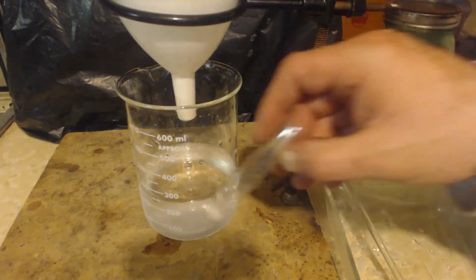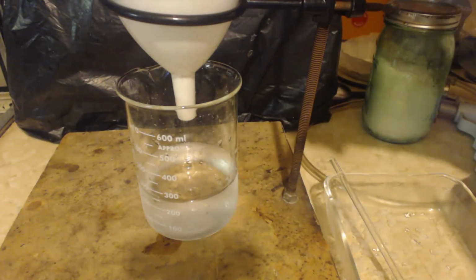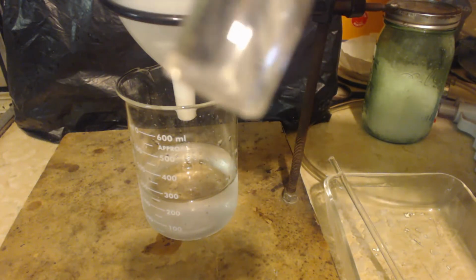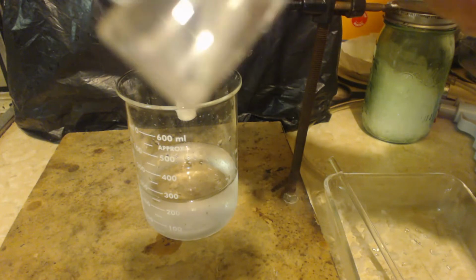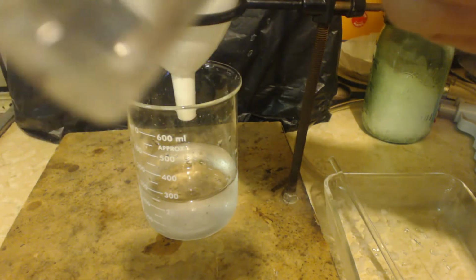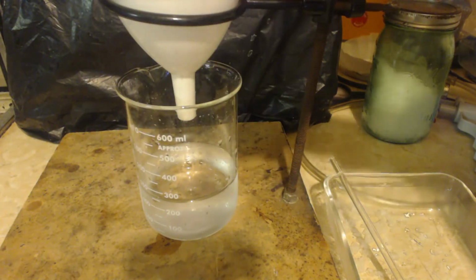So not only is that a lot of water for a lousy 27 grams of ammonium chloride, I took a little bit of sample out of the stuff that precipitated. I don't know if you can see it on camera. If you can see it down at the bottom in the corner, it's just a little dab I took out. But anyways, it's still there.